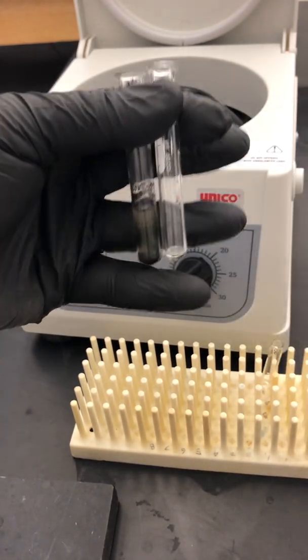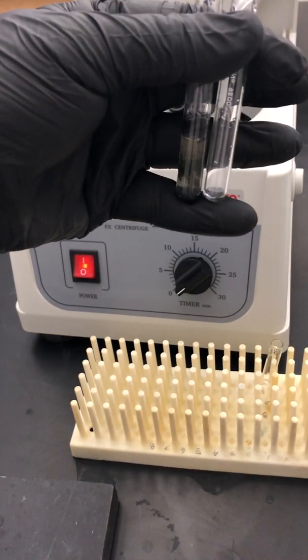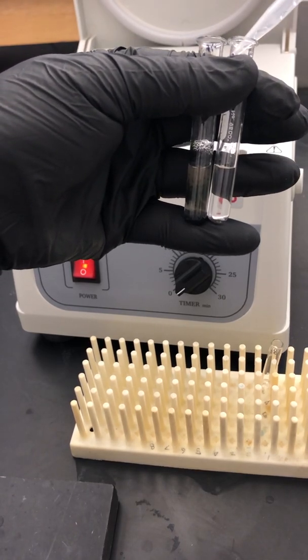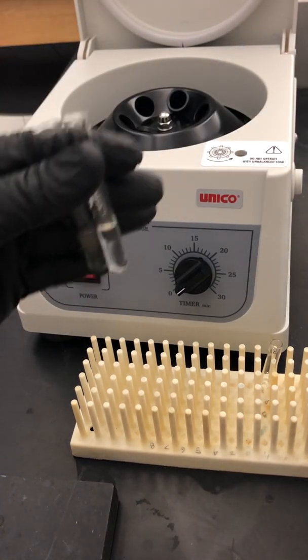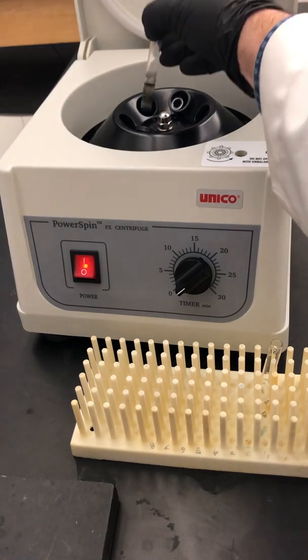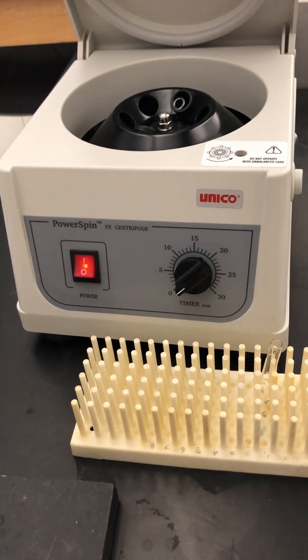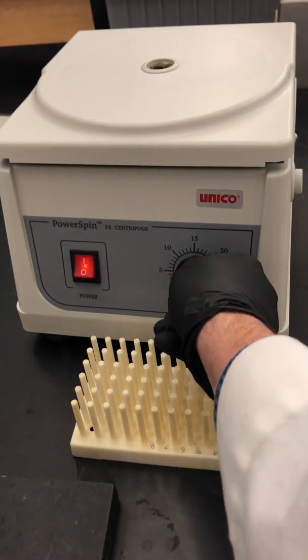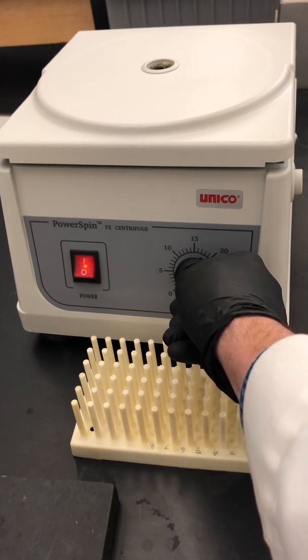I'm going to put them next to each other and use water to add enough water to the balance tube so they'll have about the same weight. Now I'm going to spin them. It'd be good to keep track of which slot your tube is in so you don't waste time when you pick it up. I'm going to close the lid, start my spin, spin it for two minutes, and then come back and decant that supernatant.